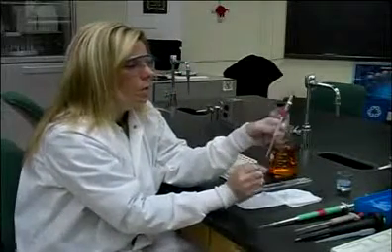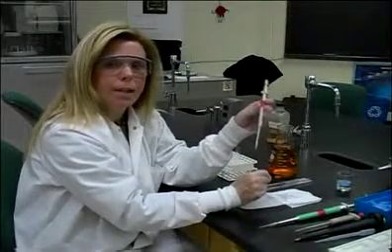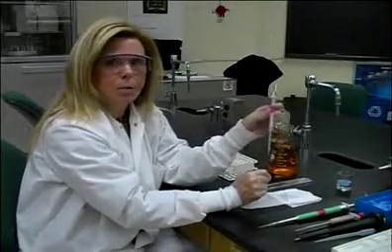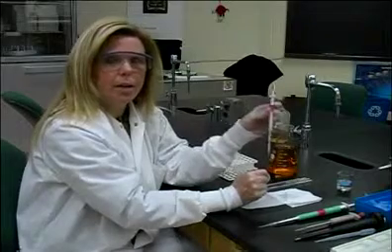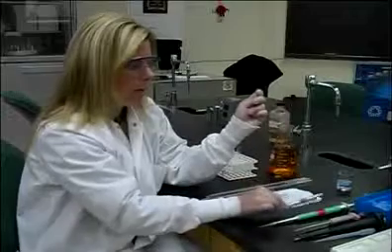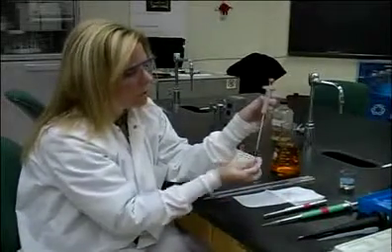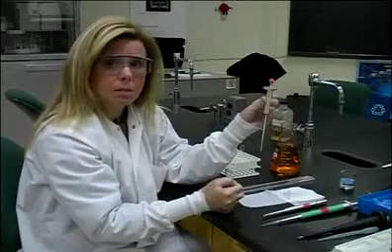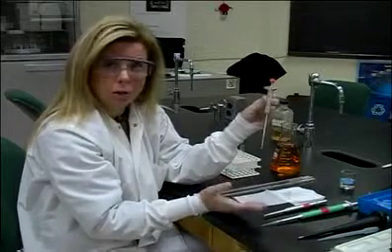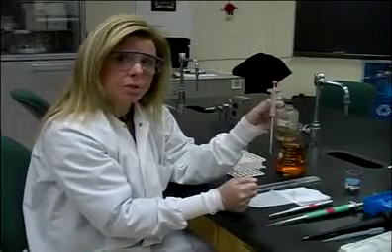When we talk about micropipettes, in particular this pipette, it uses something called air displacement, meaning that it uses air in order to aspirate the sample. There are various types of micropipettes. This one has a little plunger at the bottom. This one uses positive displacement, hence the plunger, as opposed to air. And it does not have a tip that gets changed every single time.